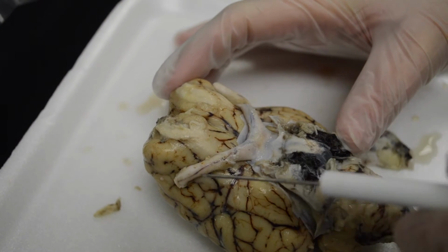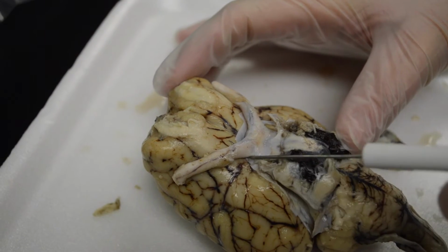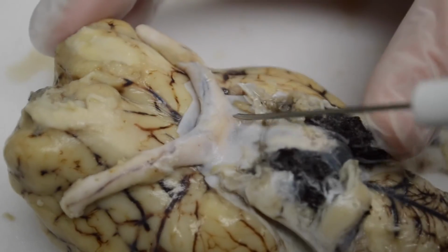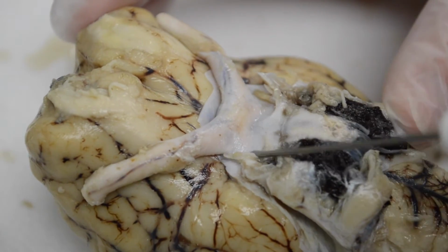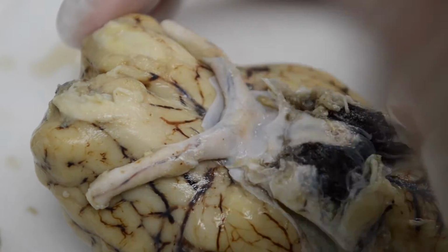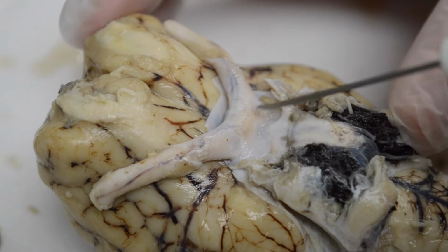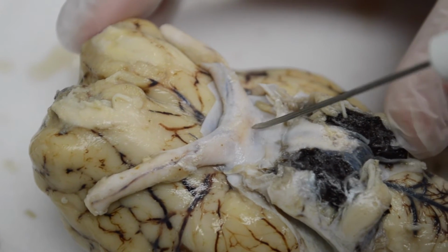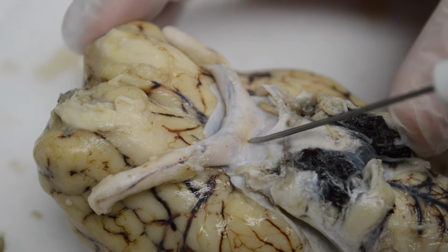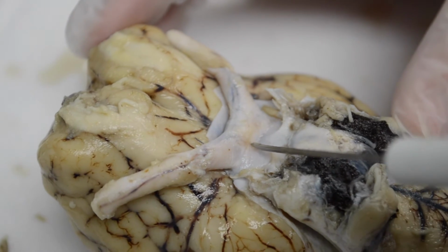These long structures are the optic nerves. And if you notice very carefully, right here, they crisscross. So this right one will come in, because we flipped it over, the right one will come in and cross, the left crosses. And where it crosses in the center, it's called the optic chiasm, where the two optic nerves cross, the optic chiasm.